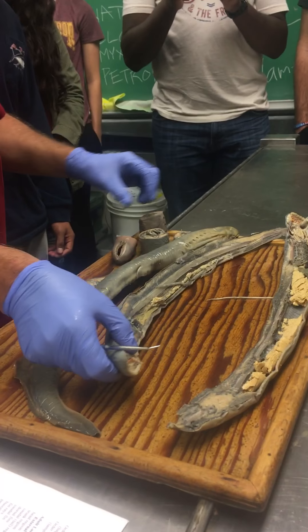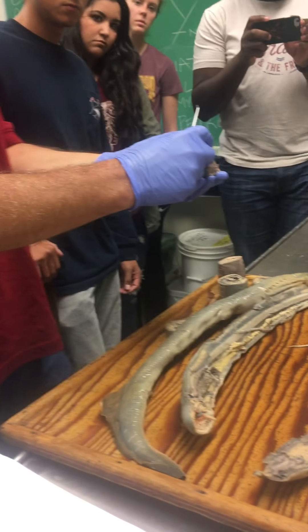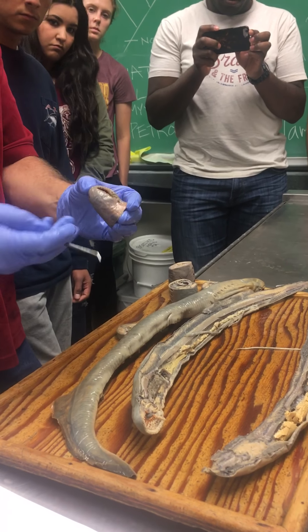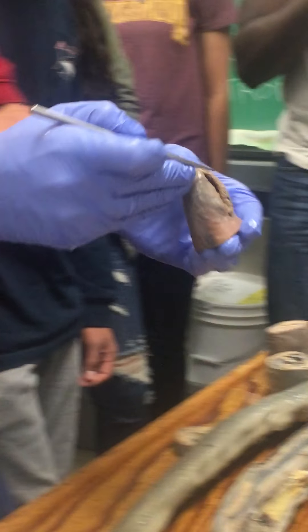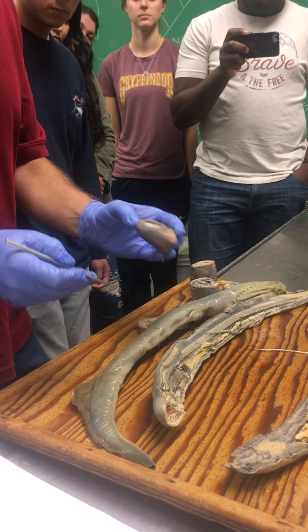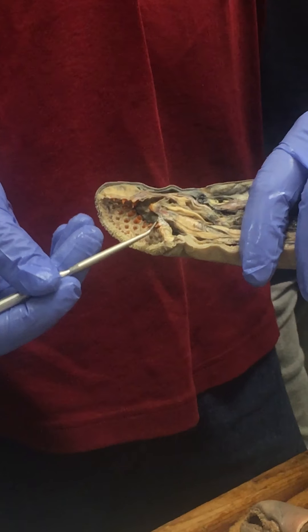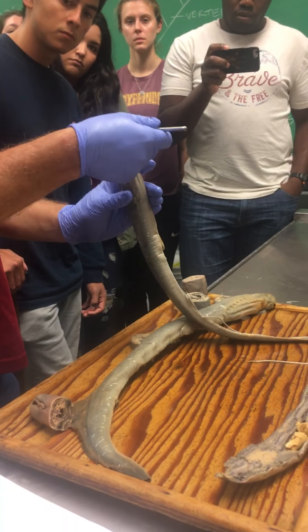The buccal funnel is this nice funnel at the front end of the animal — that's what they attach onto the fish with. There are papillae, these little finger-like structures that surround the opening of the buccal funnel. There are horny teeth on the inside; horny just means they're keratinized.